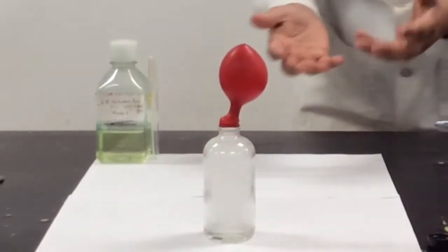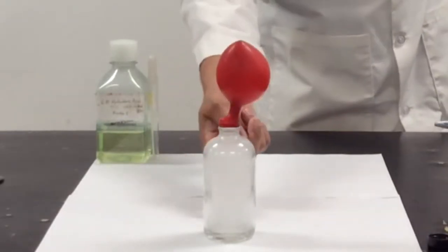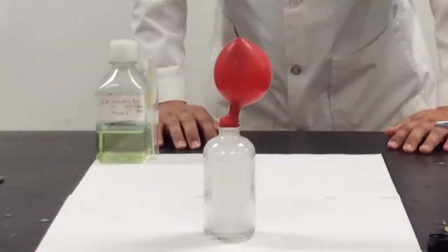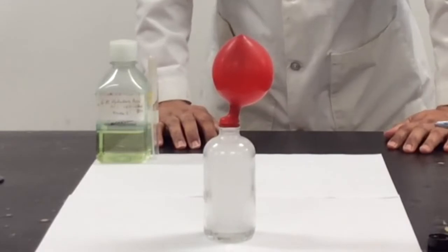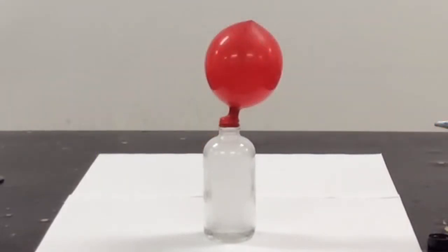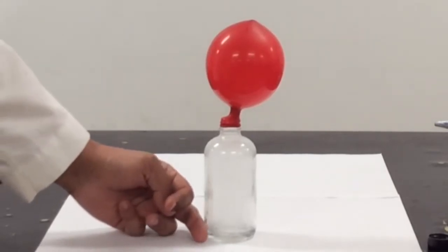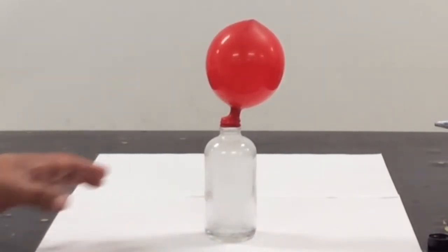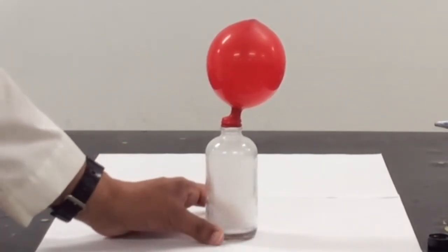As you can see we're producing a lot of hydrogen gas. You can see the bubbling down there and this is a fairly exothermic reaction. I can touch this here at the bottom and it's fairly warm so this is giving off quite a bit of heat.